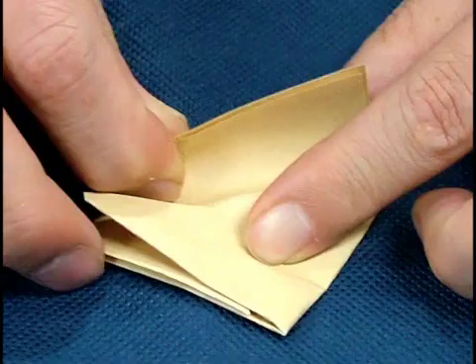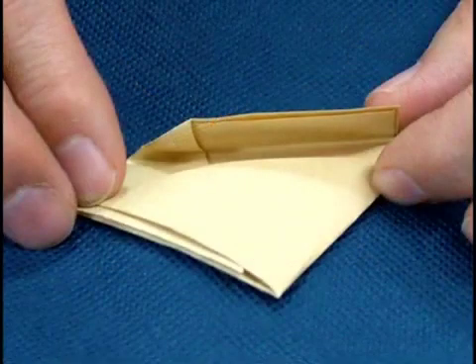Next, make a left fold approximately halfway from the top left.